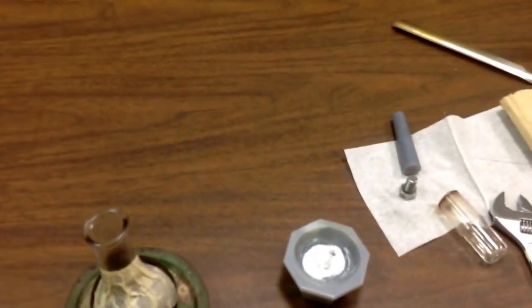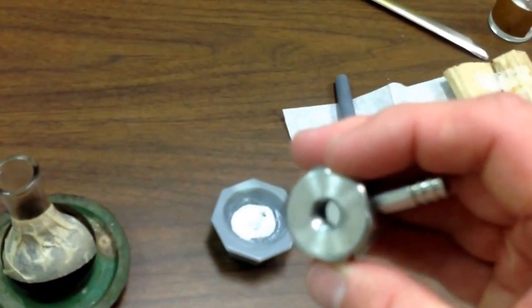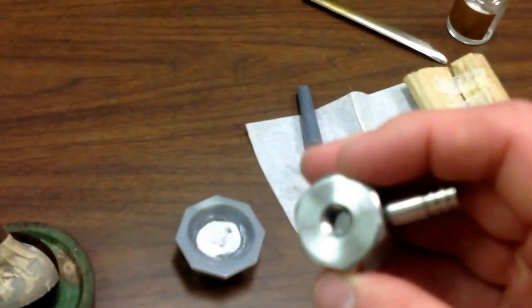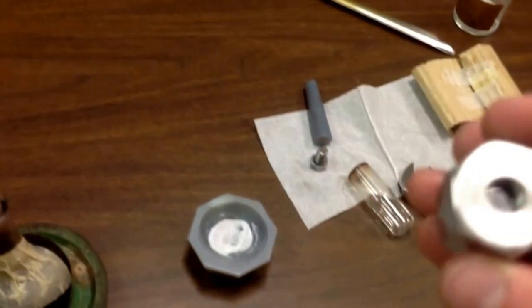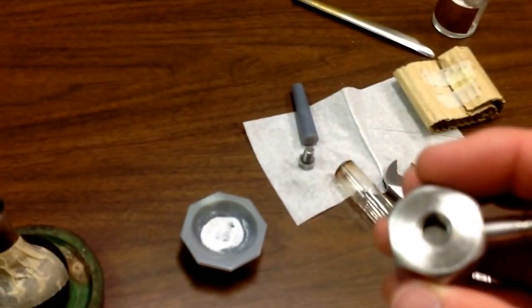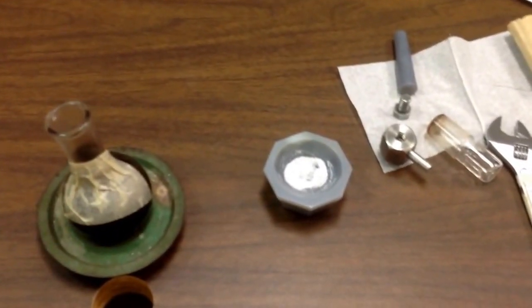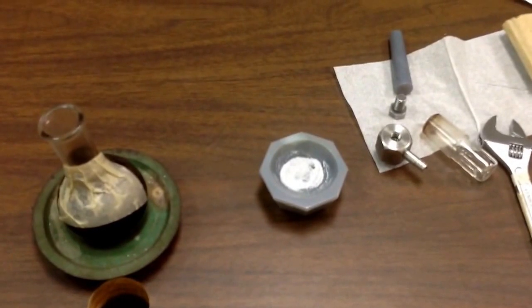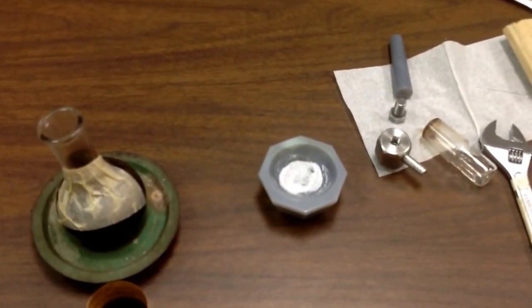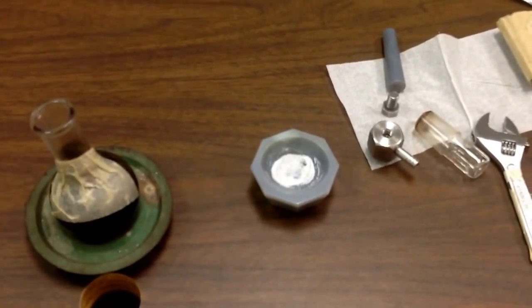And then we're going to place a small amount of that inside this little apparatus. I'll try to show you that in a moment. And then we're going to put the other screw in and tighten and try to compress that into a nice optically transparent, very thin disk or pellet that will run our spectrum. I'm going to go ahead and do this, and I'll show you in a moment.